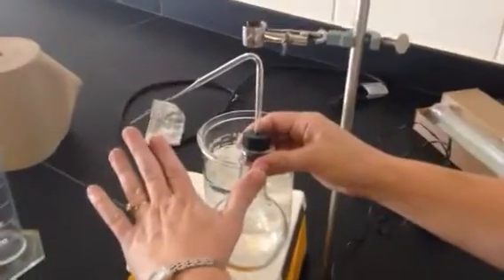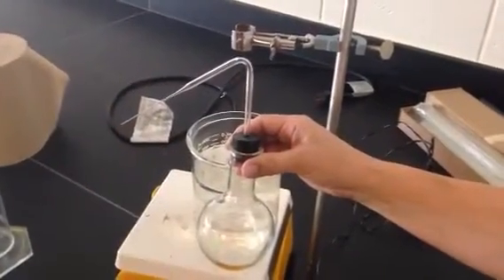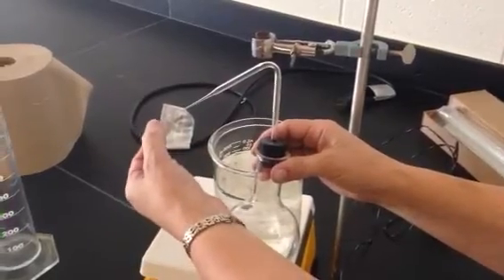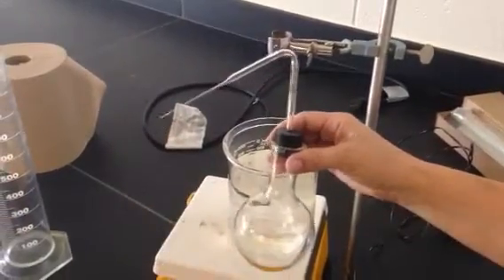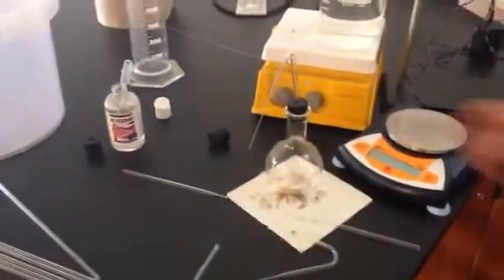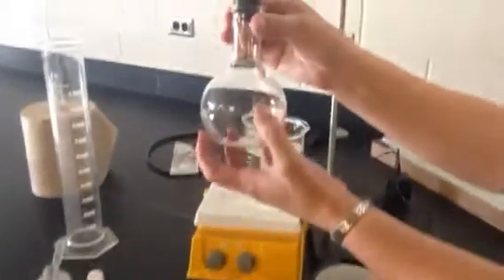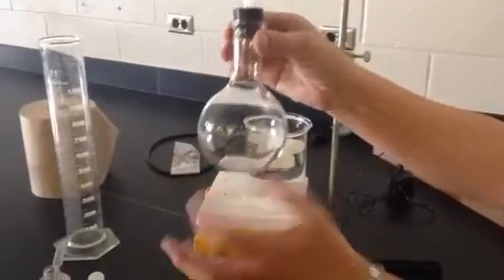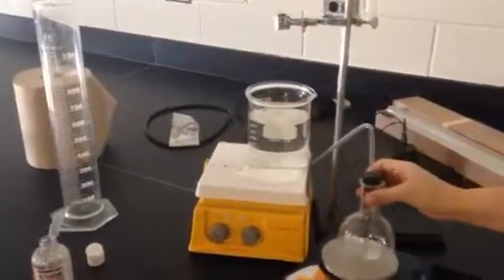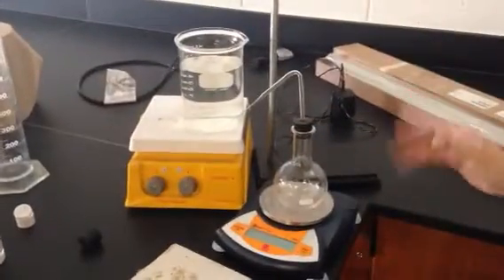When you're sure no volatile liquid is spitting out, you're going to bring your burner over in that hottest part of it, and you're going to melt the end of that shut. Then you're going to sit it around for a while and let it cool down. Some liquid's going to recondense down here. Some of the stuff you put in came out. You're going to take a really good mass at the end.